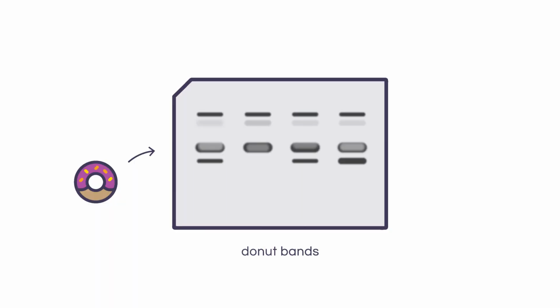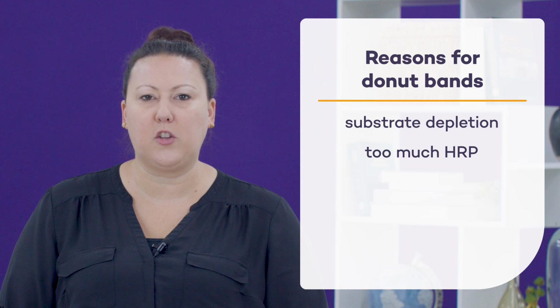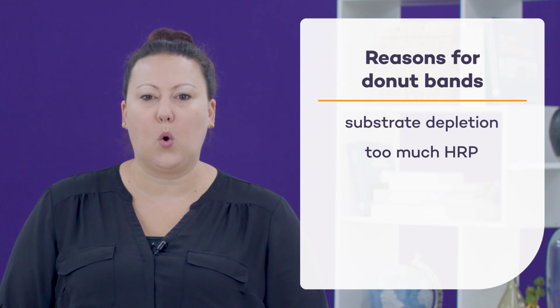You may see the presence of what we call donut bands. Occasionally, when imaging a membrane with chemiluminescence, white or negative bands can appear alongside the normal black bands. These are the result of substrate depletion, and it becomes difficult to quantitate the band in question. Substrate depletion occurs when too much of the enzyme horseradish peroxidase, HRP, is present in a band, quickly consuming most of the substrate. Reducing either the target protein or the antibody concentration should help prevent these white donut bands, in addition to increasing the amount of substrate added to the membrane for detection.